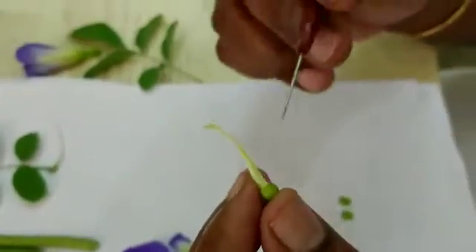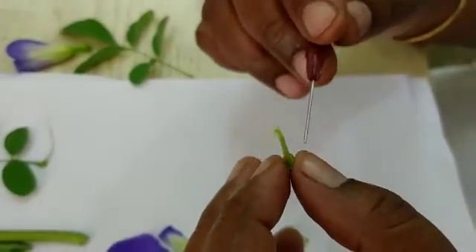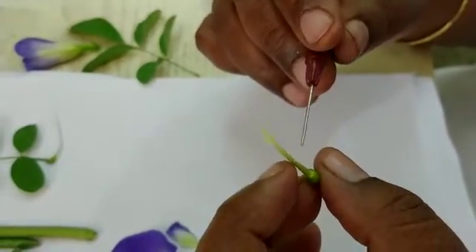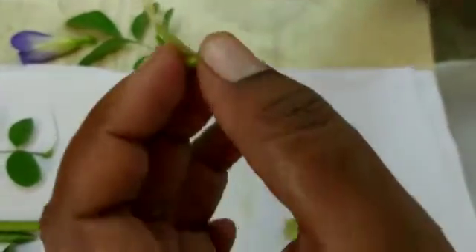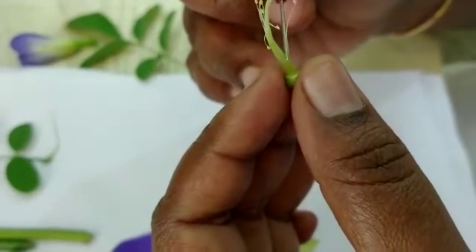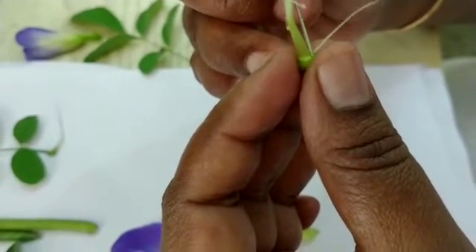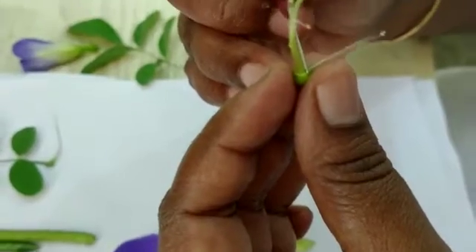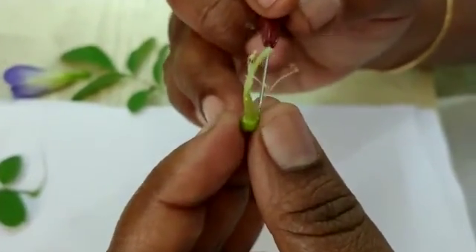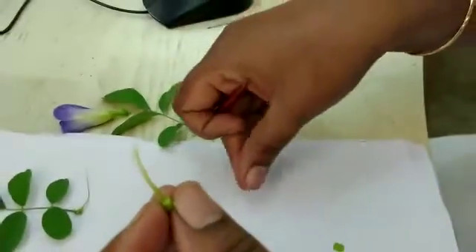Now you can see the androecium. In this androecium, one stamen is separate and the remaining nine are making a bundle. This condition is called the diadelphous condition — one stamen separate and nine stamens united.